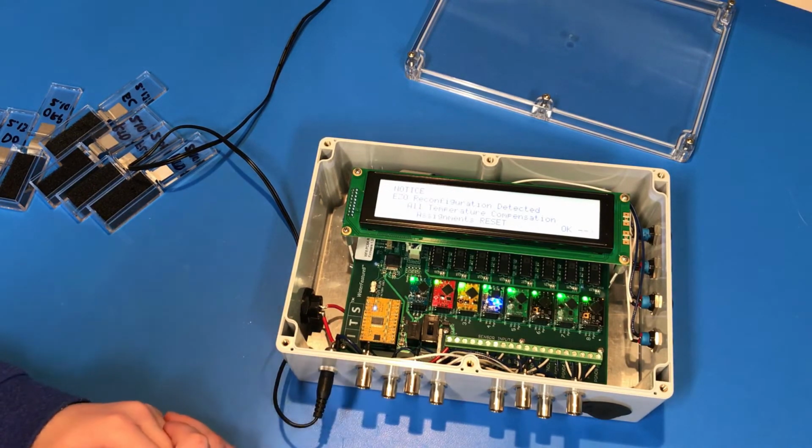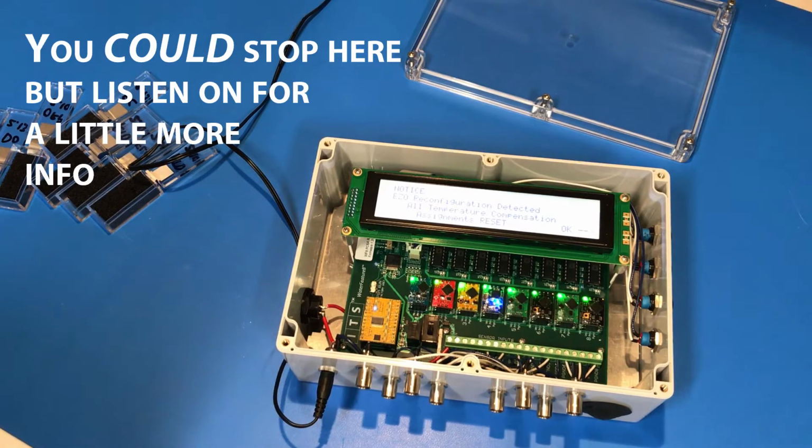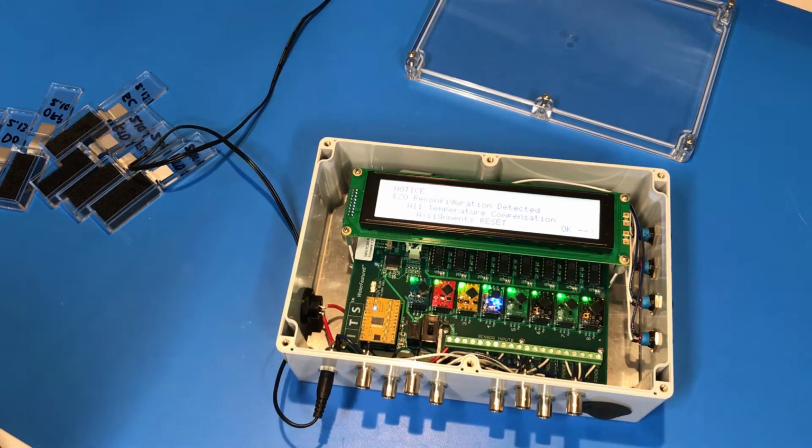Now you're all set. When you see this screen on boot, it says, hey, I noticed you got a different order of EZOs installed in these sockets. When I build these machines, I test them and install EZOs before we ship them. We check to see that we get the correct outputs and the correct settings on the screen and that everything's working properly. Well, the random order of EZOs that I install to check that are likely going to be different from what you use in your final installation. So you should expect to see this screen when it turns on.